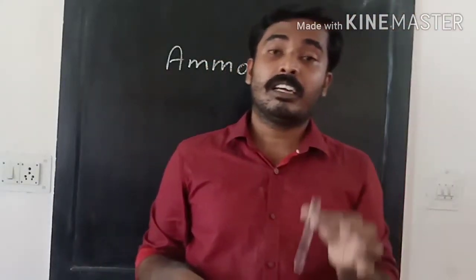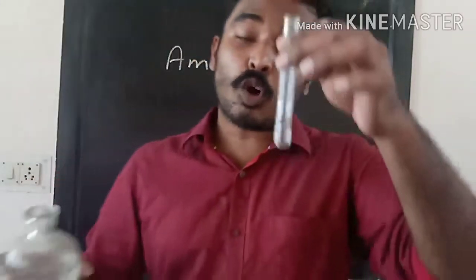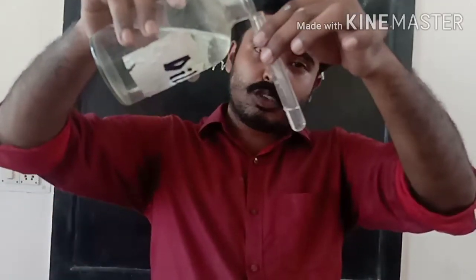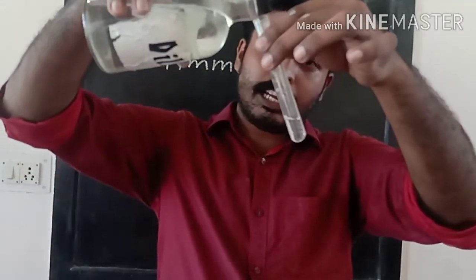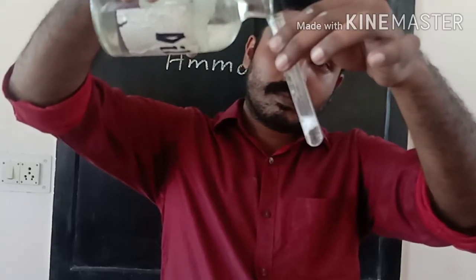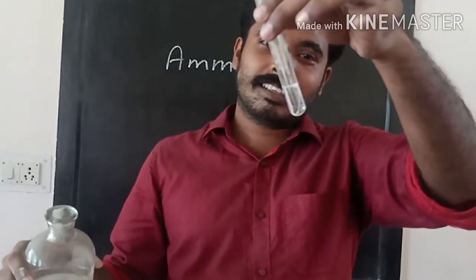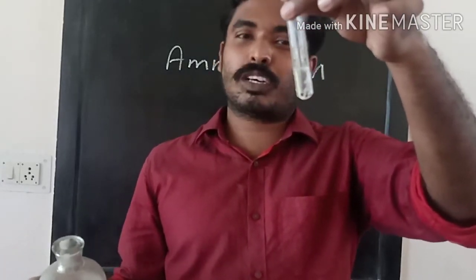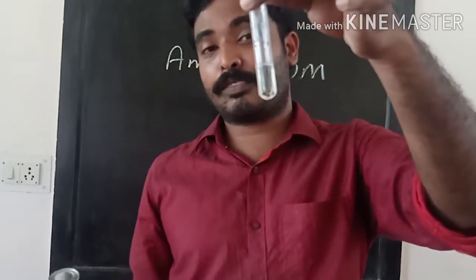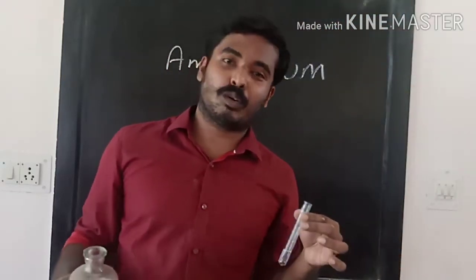Now I will add dilute HCl to it. Please observe the test tube carefully and what's happening. I am adding dilute HCl to it. What can you see? Brisk effervescence was formed, isn't it? Bubbles are still coming. Brisk effervescence has formed. These bubbles are carbon dioxide.